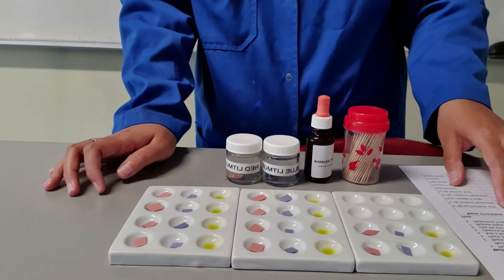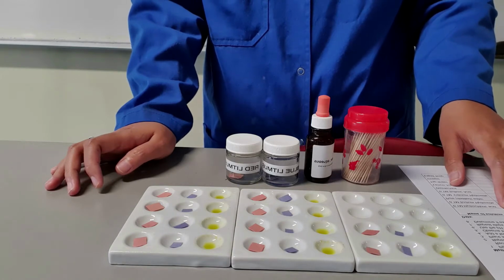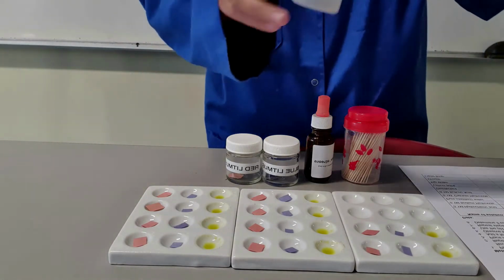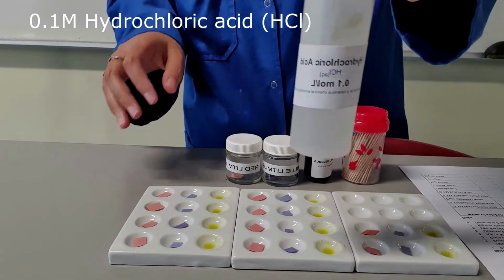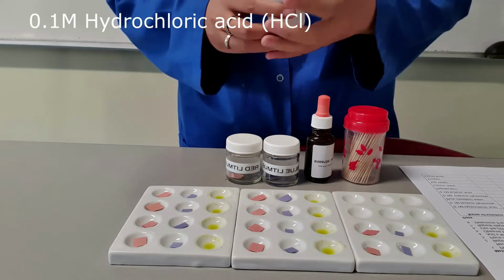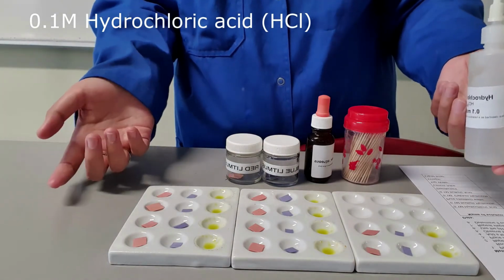So as you refer to your worksheet, you will see that there are 10 substances that will be tested, starting from the first substance, which is hydrochloric acid. Okay, so hydrochloric acid. From the name itself, we would know that hydrochloric acid is an acid. So we will see whether the experiment result will confirm that it is the case.